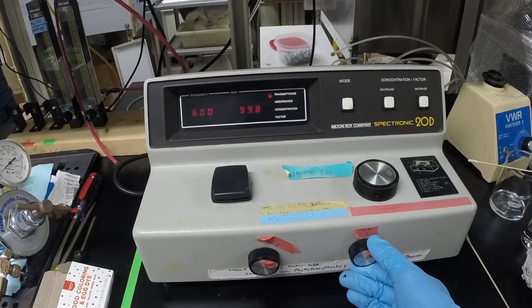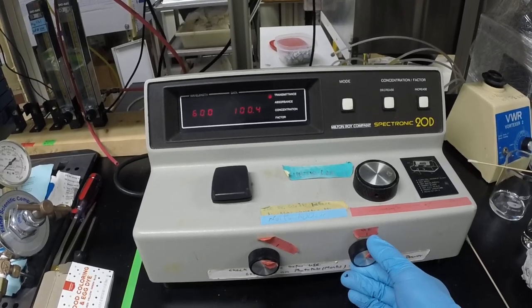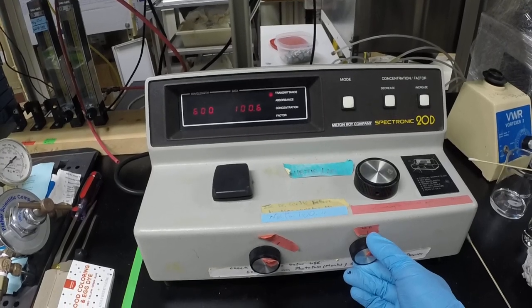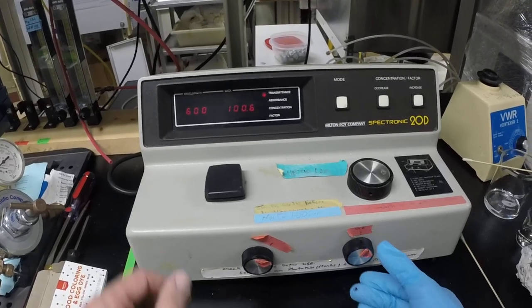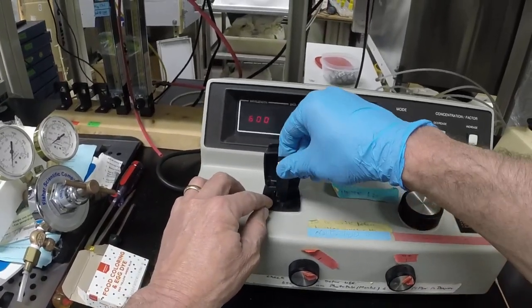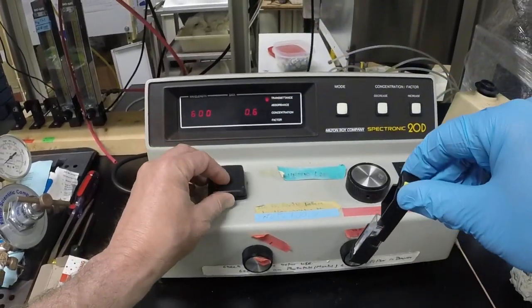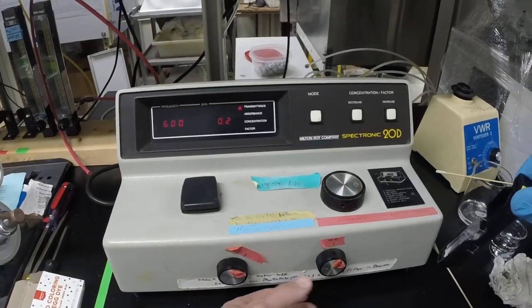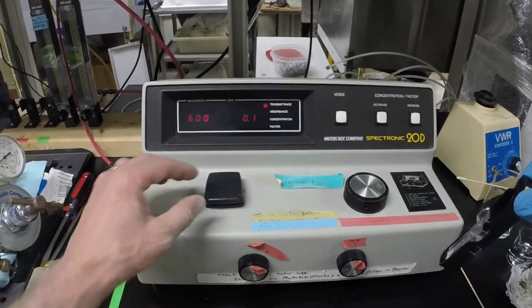I like to check to make sure, especially with this case of a new bulb, and we're just burning it in right now. I take that back out, then it should go back down to roughly zero transmittance again. You can see we're essentially there.